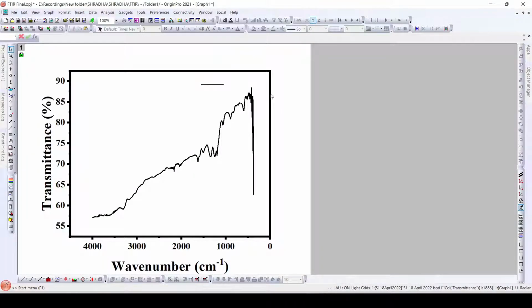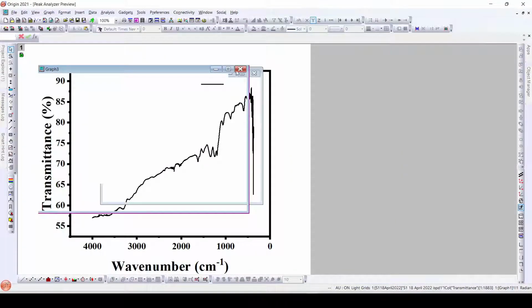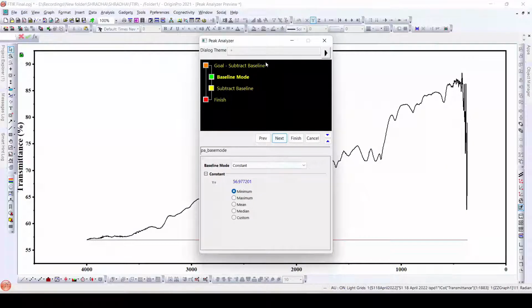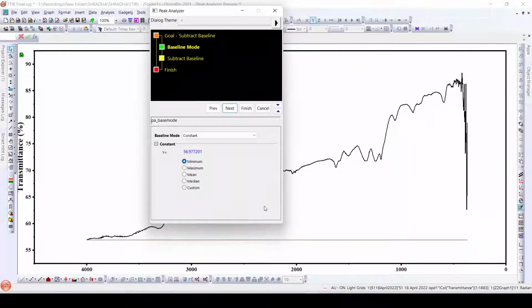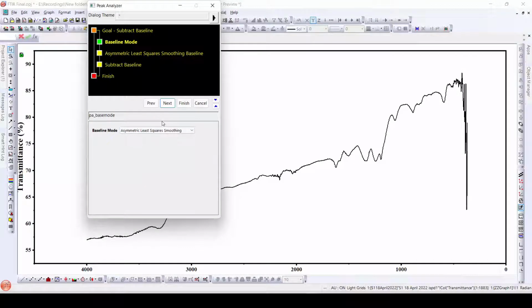So in order to have the baseline in this graph, what we usually do is go to Analysis, Peaks and Baseline, Peak Analyzer, Open Dialog. Once we open the dialog, we see we can subtract baseline. I'll do it, recalculate to auto. Next, here as we can see, it is considering from this value. If at all we are adding a baseline to this particular data, it will get added to these values, and to the data from the lower side of this graph, it will add a baseline, which is not expected or required for us.